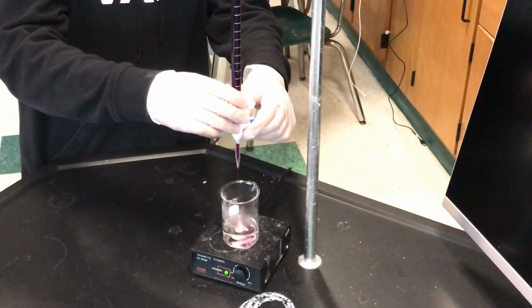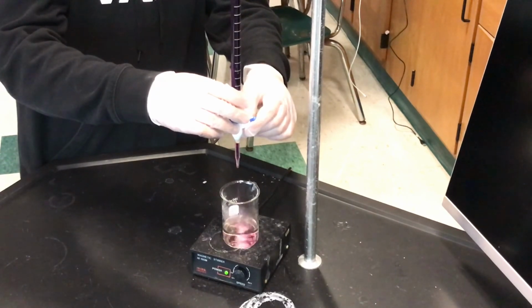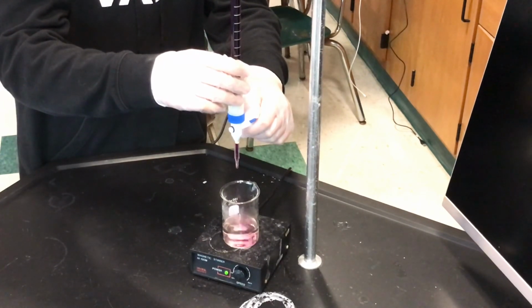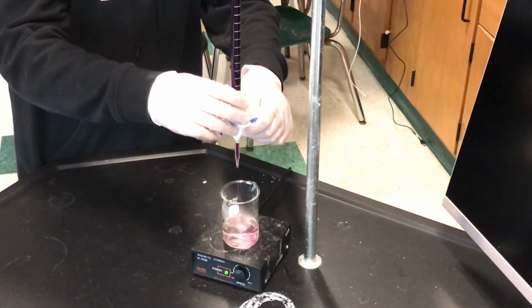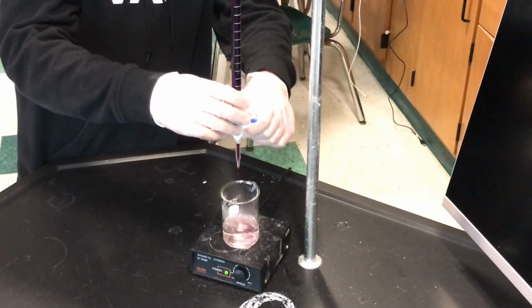So when it turns purple? Yeah, turn it on a little bit. You can open it up a little bit. I'm not going to yell at you yet. Yet. Okay, yes, that's the key word. Now, you know when you're getting close when the color lasts a little longer, right? And right now it looks like it's dissipating.